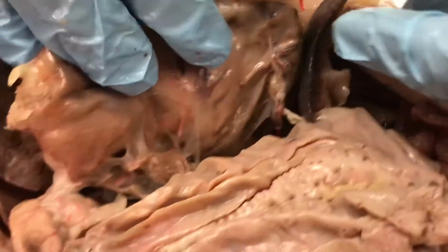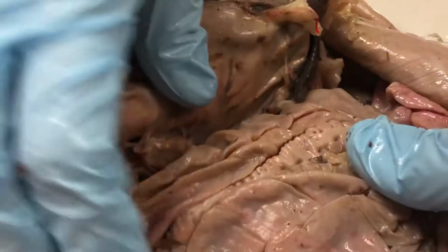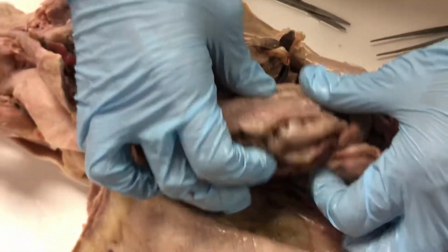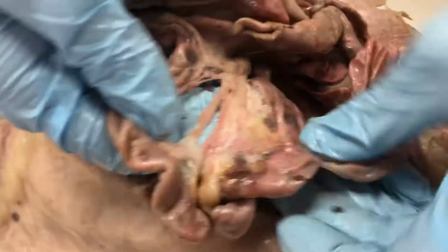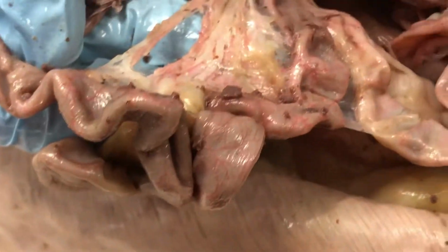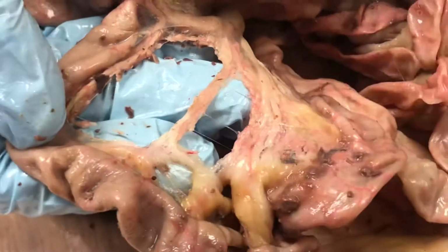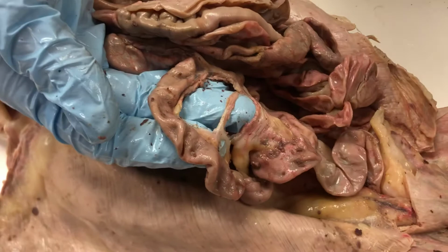All right. Now we're going to move on into the intestines. Before you get into the intestines, I want to show you all of this mesentery right here, which is all of the material that's supplying the blood to the intestines. I wanted to show you this now because I'm actually going to separate out all the intestines so that you can see the whole length of the small intestine, cecum, and large intestine.